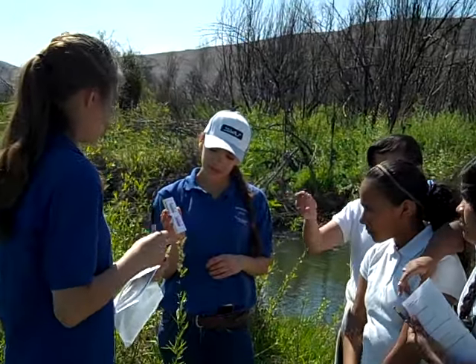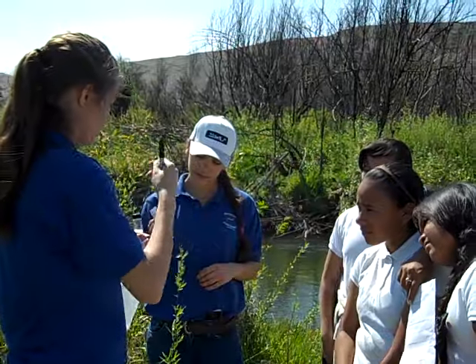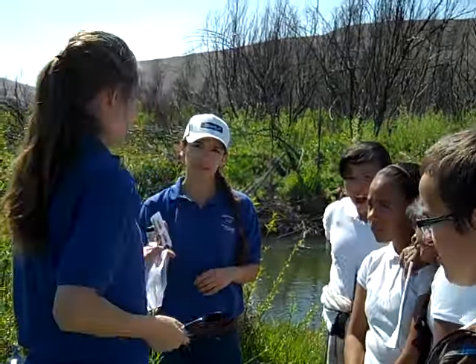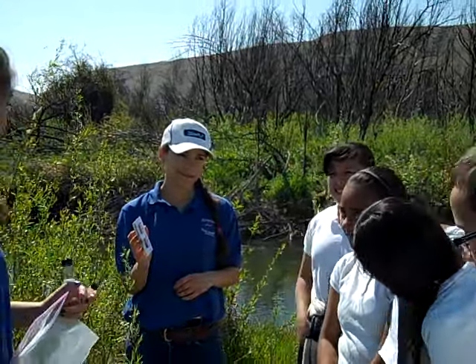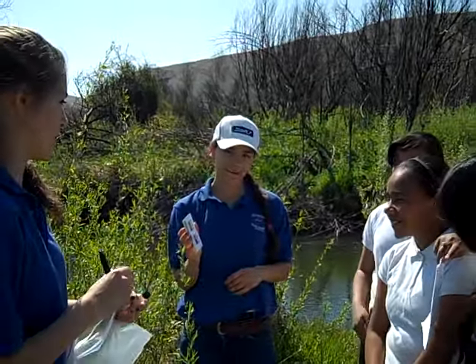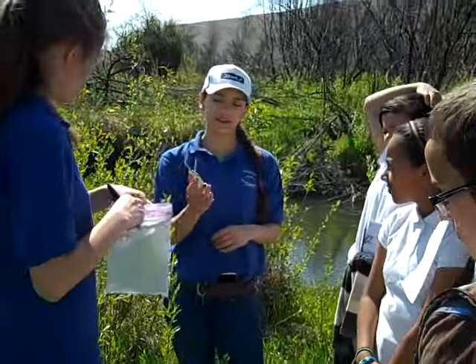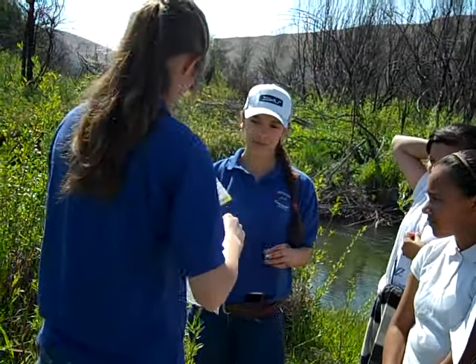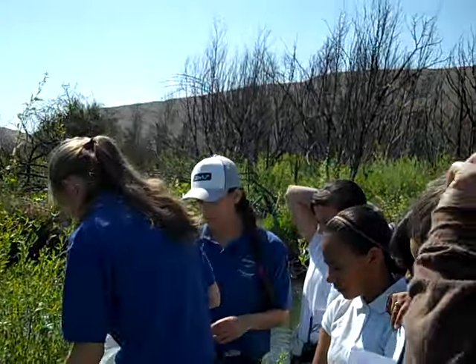So if we've got some cows over here, horses or pets or whatever that are doing their thing in the creek, then there's bacteria in the water. So if it's red, it's negative, and if it's yellow, it's positive. Okay. You can see. I'll put that in there. And we're going to look at this now. Negative. This is the difference.